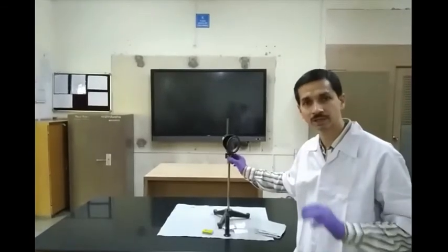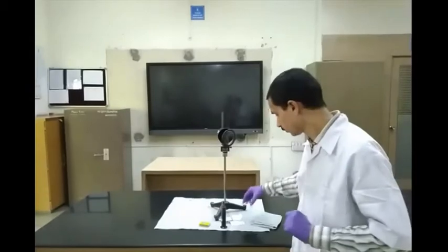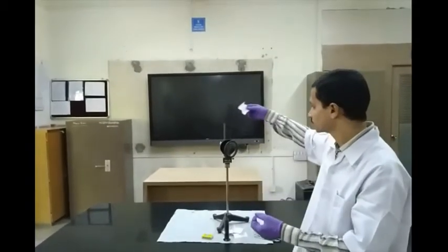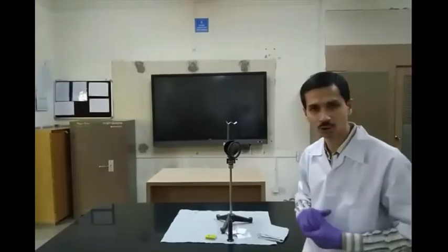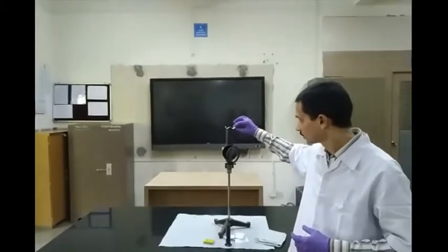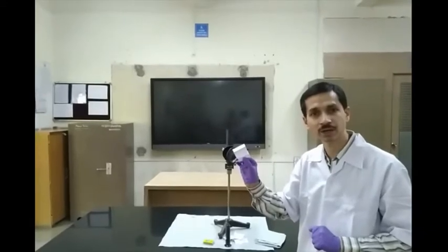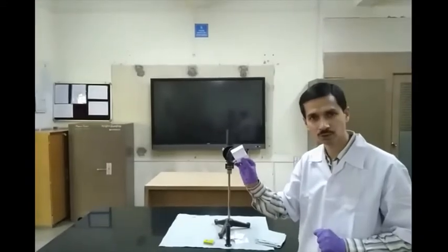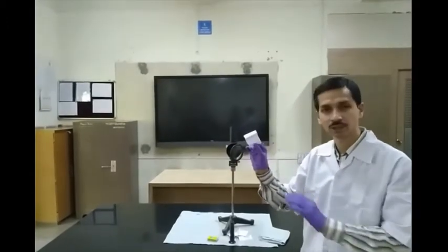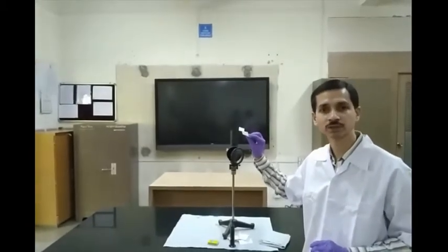We find the exact height of the flame which produces no smoke. For that we use these paper chits. Once the experiment has started, we place these paper chits on the top and allow them to remain for some time. We then check whether soot is collected on the white background. If soot is collected, then smoke is being produced. If the paper chit remains plain white, then that height of the flame is considered to be the smoke point.